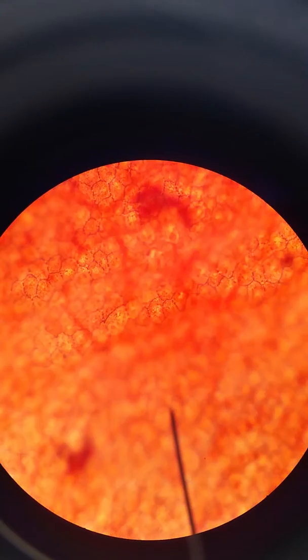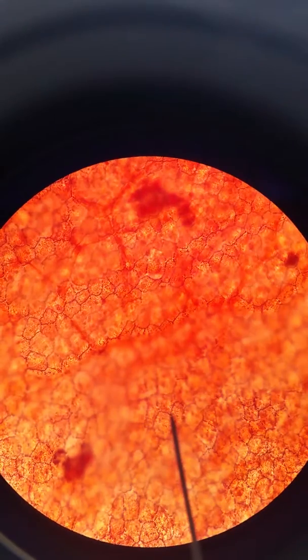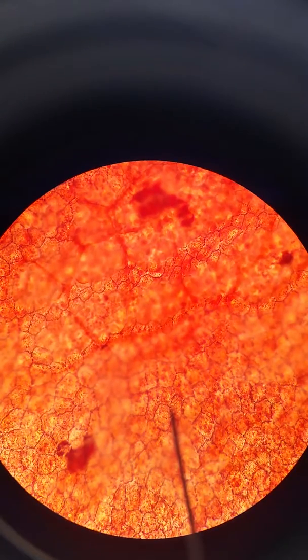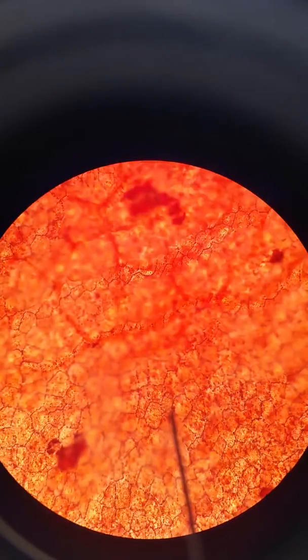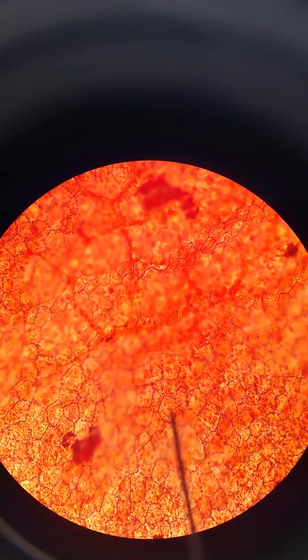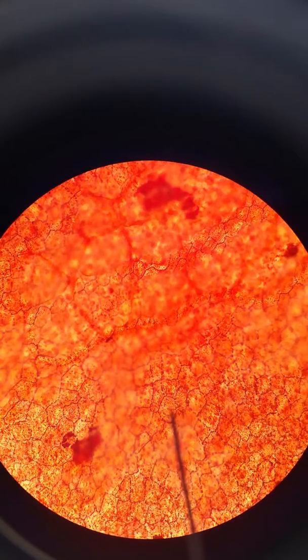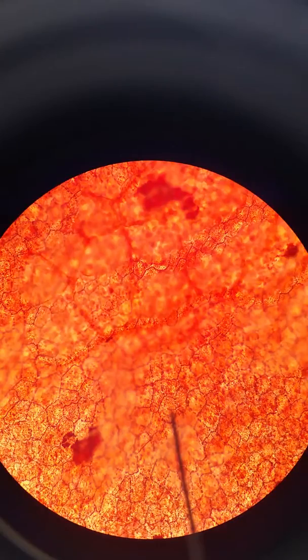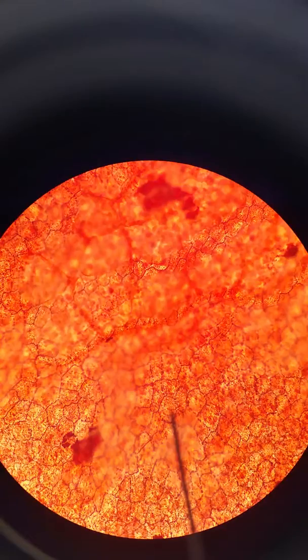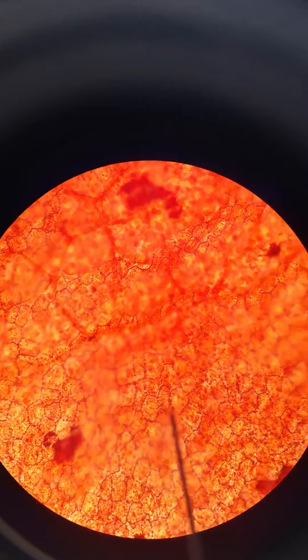Now we're actually starting to make out the boundary of these cells. Sometimes you have to go in and out on the focus in order to make out the boundary. I now have the pointer right in the middle of one of those cells, and you can see that distinct line going all the way around — sort of making a circle or an oval. That is the cell membrane, or the plasma membrane, of one of those cells.